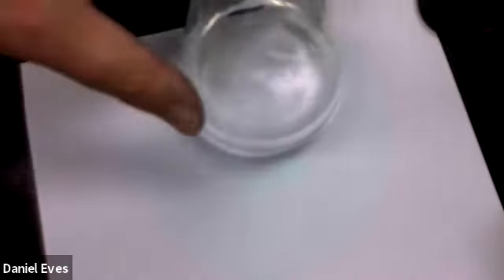And just to remind you that this was 0.2 grams of the diprotic acid, and we're using the sodium hydroxide solution that we had generated, so that should allow us to determine the number of moles of hydroxide in the solution after we add it to this unknown acid.